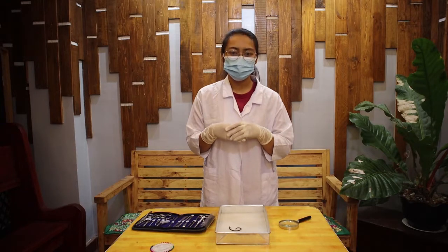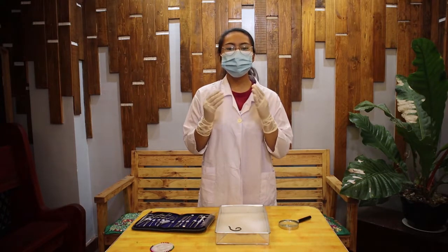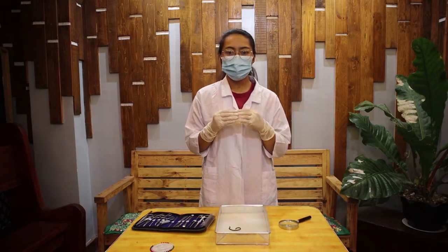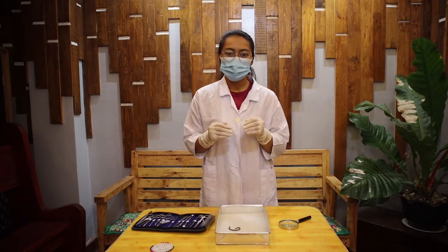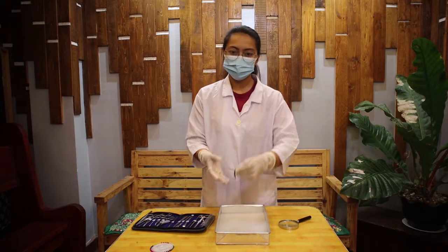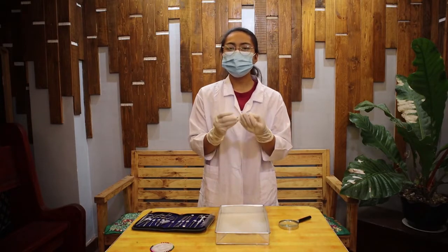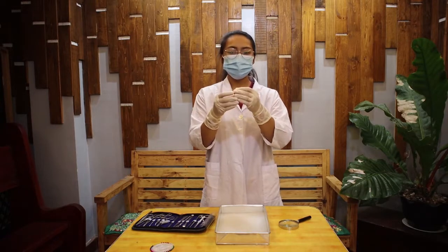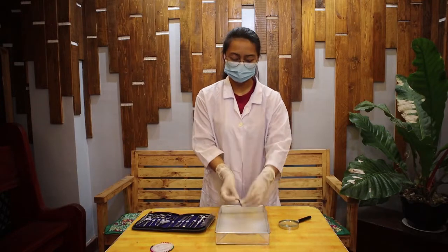They are also hermaphroditic, but they do not self-fertilize. Earthworms are vital to soil health because they transport nutrients and minerals from below to the surface via their waste, and their tunnels aerate the ground. So as we dissect the earthworm today, we will observe the internal and external structures, as well as the different developed organ systems as well as the hollow body cavity.